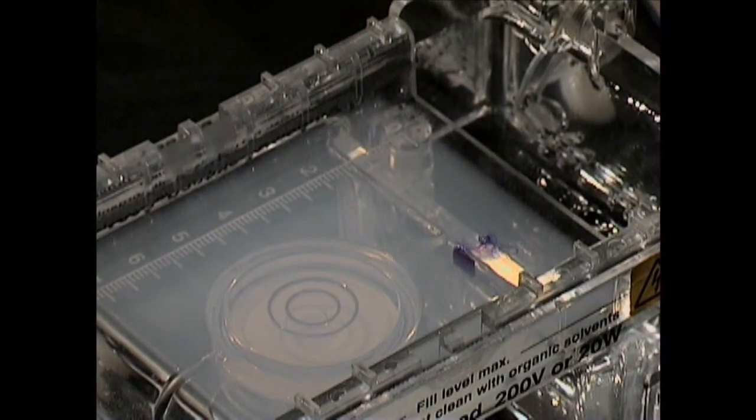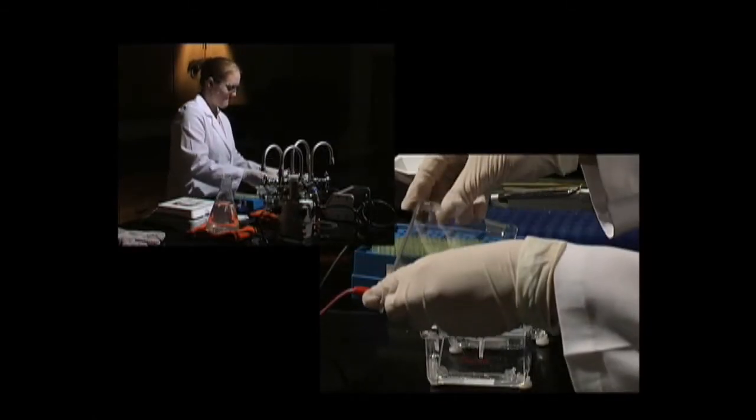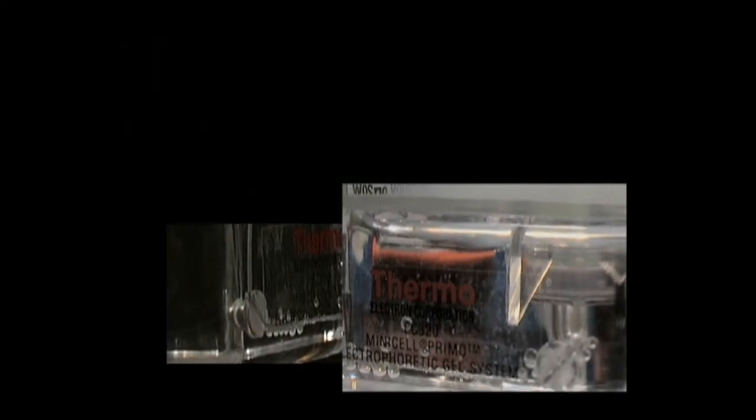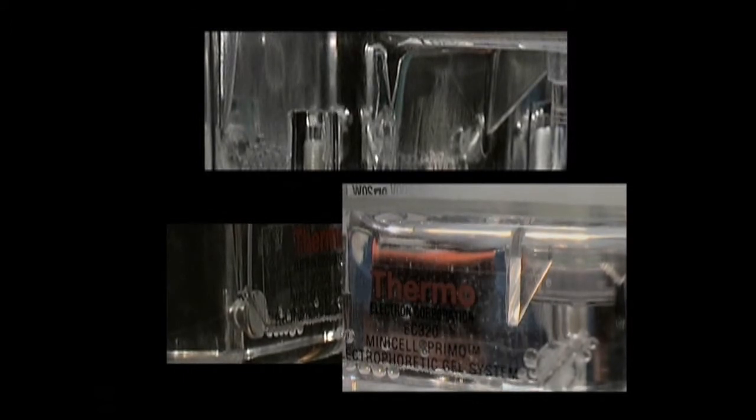Snap down the covers of the positive and negative electrode terminals, and make sure they're properly oriented. Connect them to the power source, and run the electrophoresis for a time specified by your instructor. Bubbles should form on the electrodes if the current is flowing. Allow the tracking dye to migrate at least 4 centimeters to allow the DNA bands to separate.